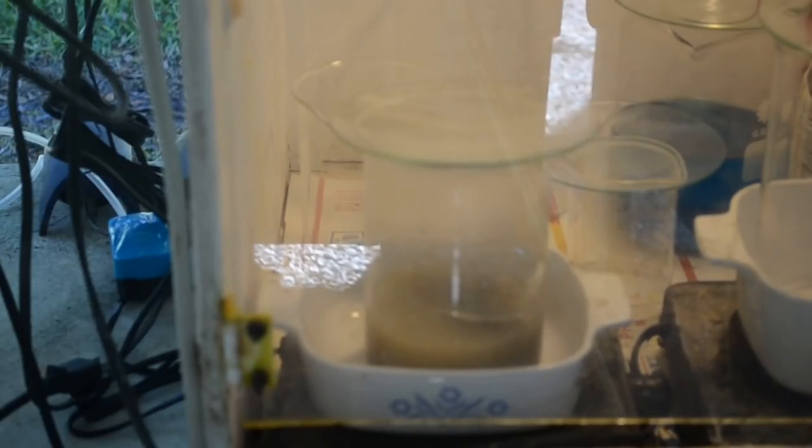And once all the gold's gone, we'll cool it, dilute it, and filter it, and then re-precipitate the gold. And might be able to get it cleaned up and weighed and see how much I got from that first half of the VGA RAM chips.